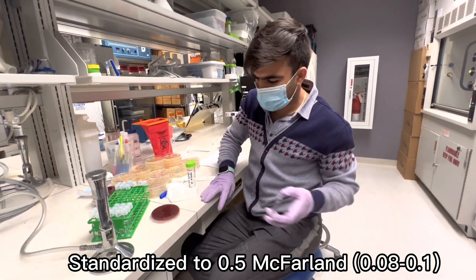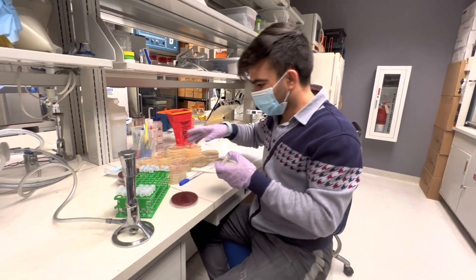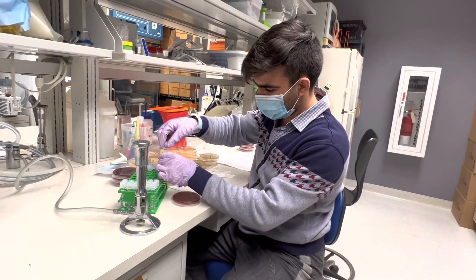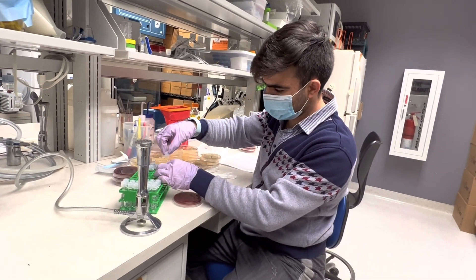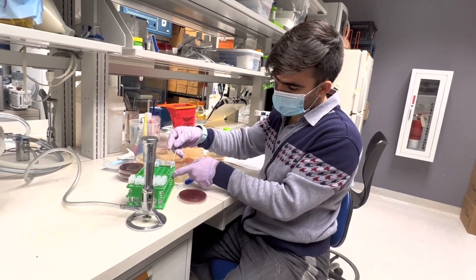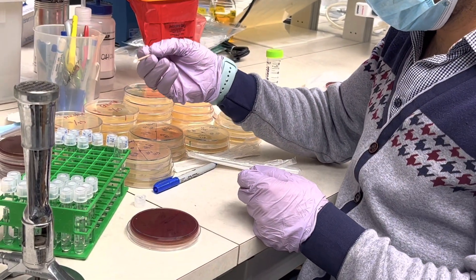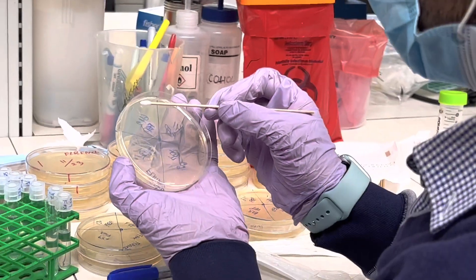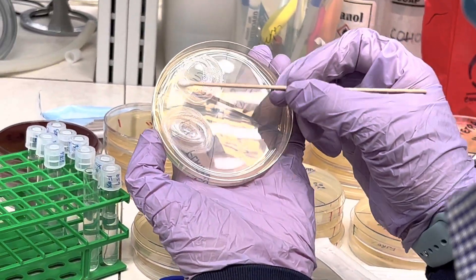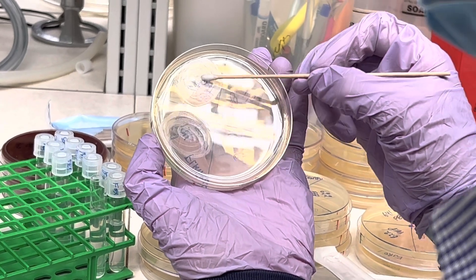Now I can move forward with inoculating onto the plates. I need a sterile swab. With that I can take the bacterial isolates and add them to the plate. That's it.